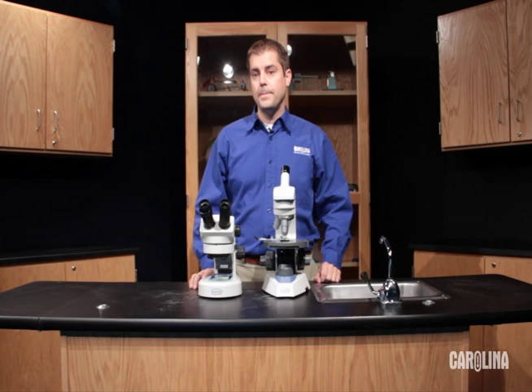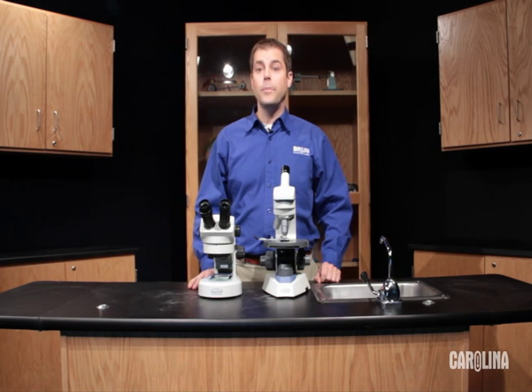Now let's discuss the proper way to use a compound microscope. Remember this microscope is different from a stereo microscope in that it is used to view microorganisms.